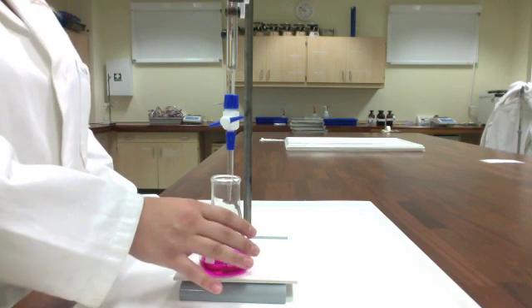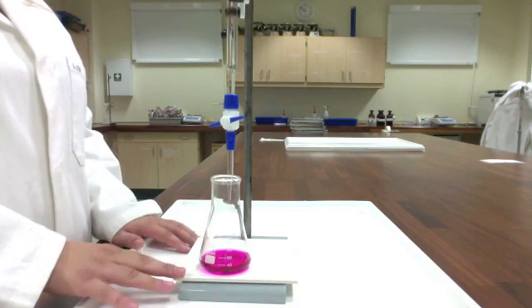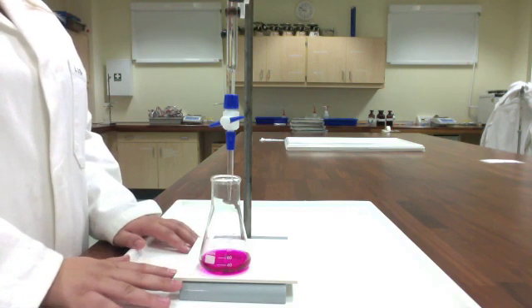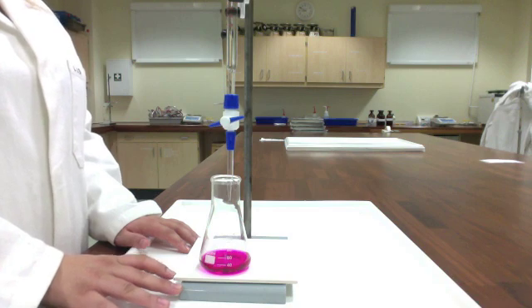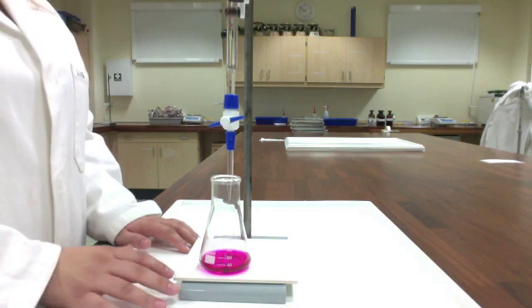So I'm going to put this one aside so that we have something to compare to, and I'm going to prep my next sample to get ready for my next three trials of this titration.